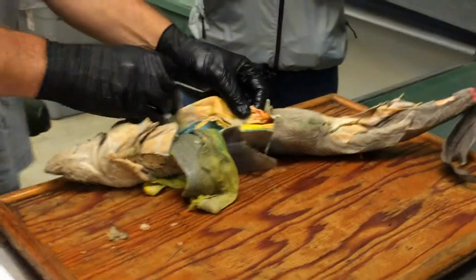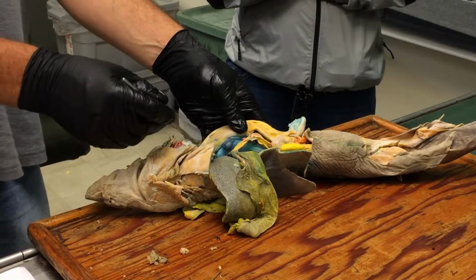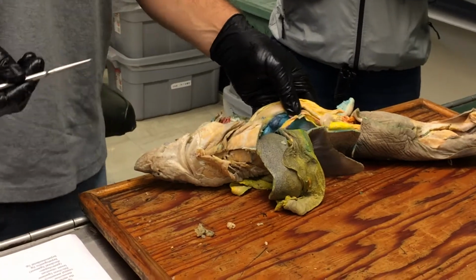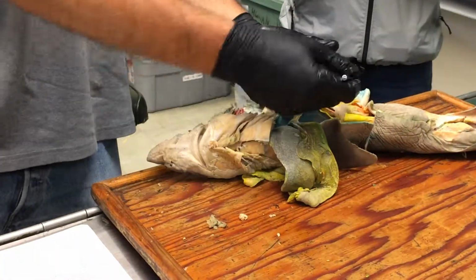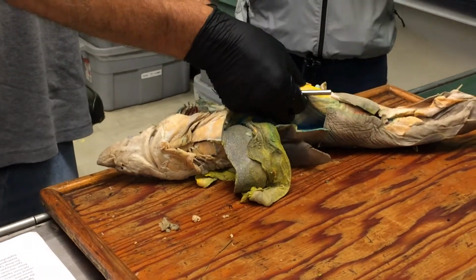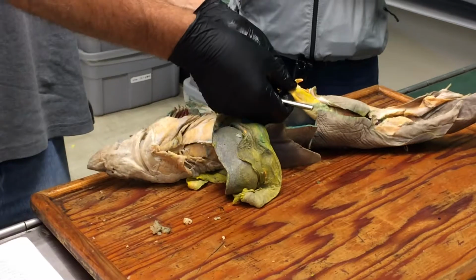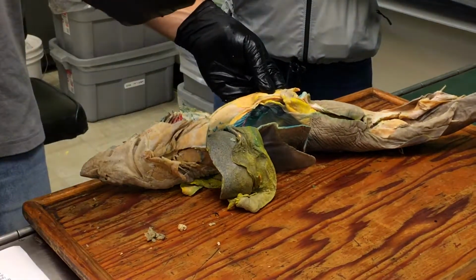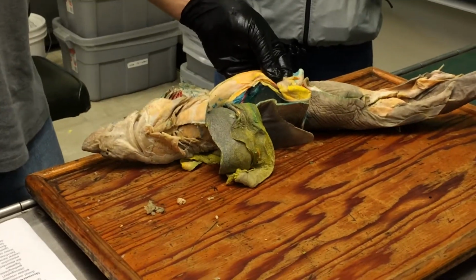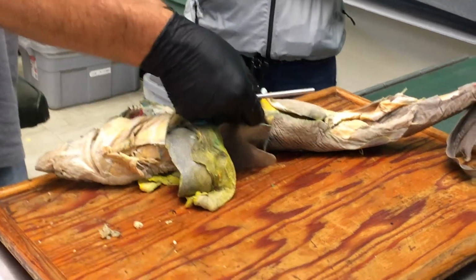And then there are some names for different parts of the stomach. The cardiac region of the stomach is the part that's closest to the heart, the top of the stomach or cranial end of it. Makes sense. The body is the main part of the stomach. Big surprise. The pyloric region is the last little bit of the stomach right before it goes into the intestine. If you feel it, you can feel a thick muscular valve in its wall because there's a pyloric sphincter in there that restricts flow of things out of the stomach until it's ready. Pylorus is that actual sphincter; the pyloric region is the region.